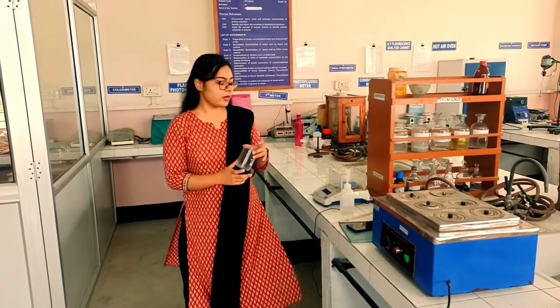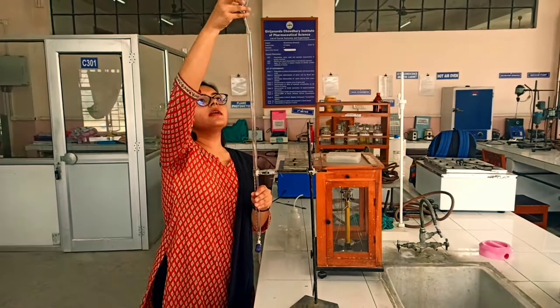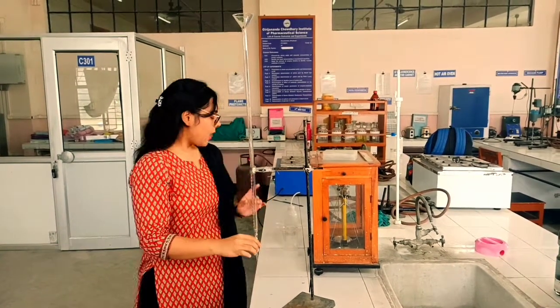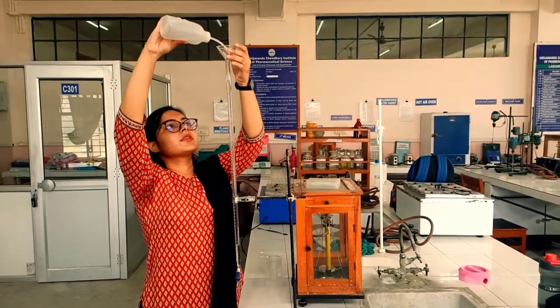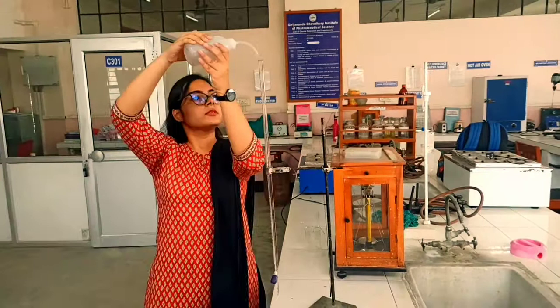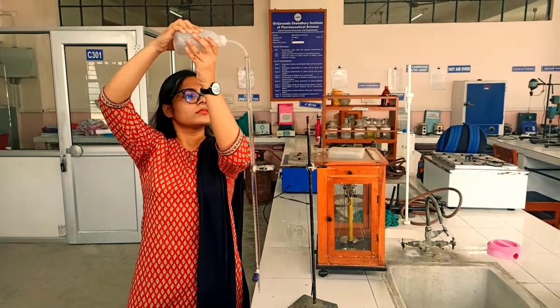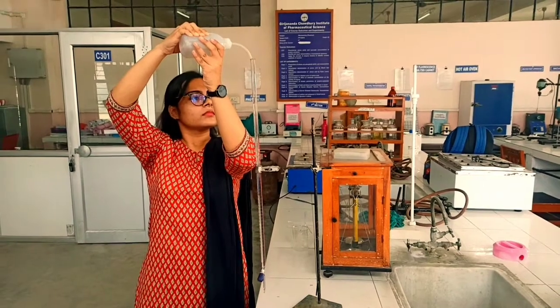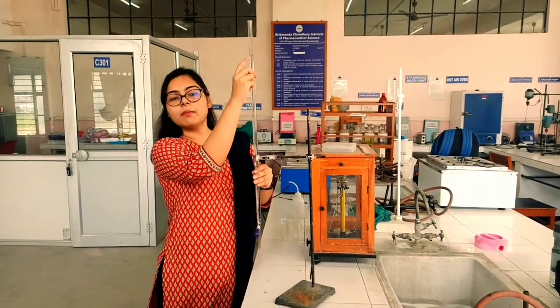The weight of the empty beaker is 101.17 grams. First, we have to place the funnel at the top of the burette, then check that the stopper is closed, and only after that fill the burette. Be very careful while you fill the burette. As you can see, we fill the burette till the bottom of the 50 ml mark with distilled water.